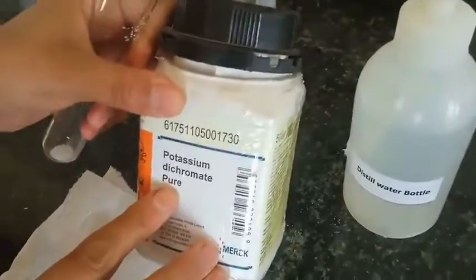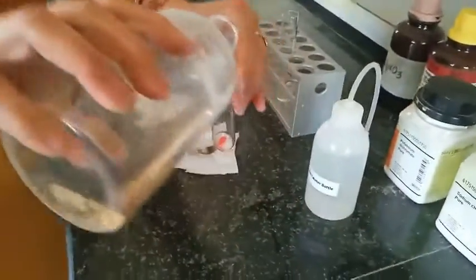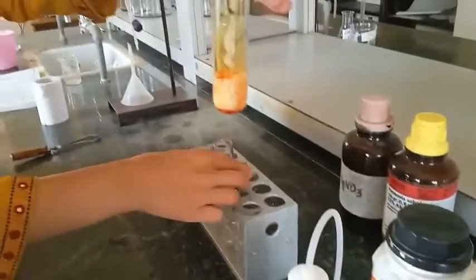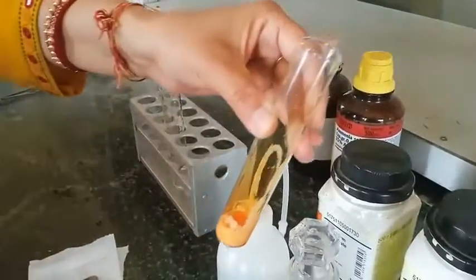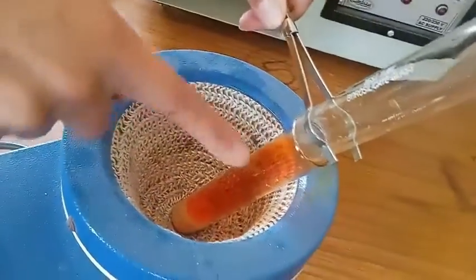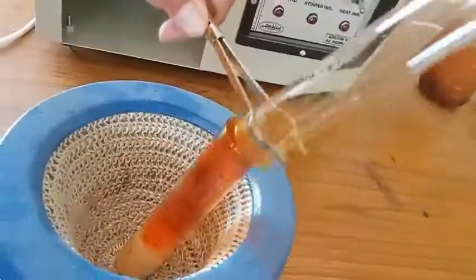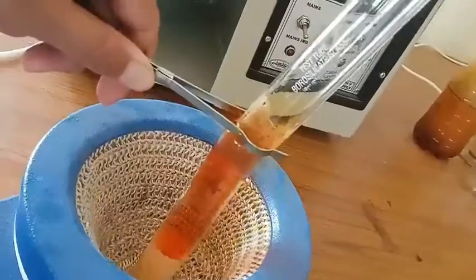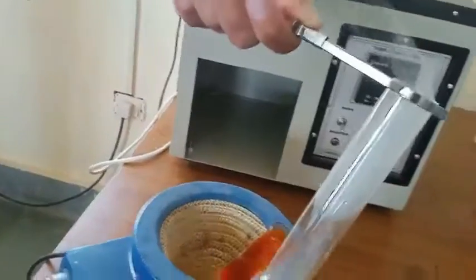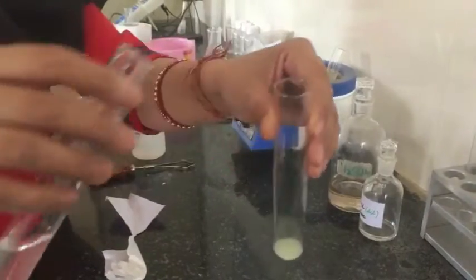I have taken salt and to this I am adding potassium dichromate and H₂SO₄. Here you can see the reaction and brown fumes near the walls of this test tube. Now we are heating it to collect these vapors in another test tube — from the sides you can see the vapors coming out. This is not the proper way to collect the vapors; a special arrangement is needed. To these collected vapors I have added NaOH solution, and then lead nitrate solution, which gives a yellow color. Due to low concentration the intensity is low.